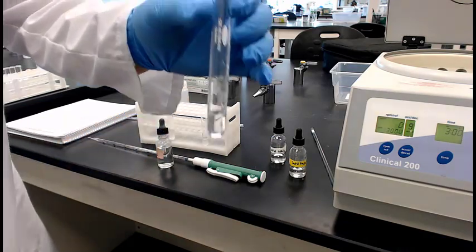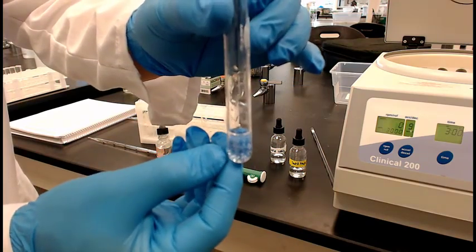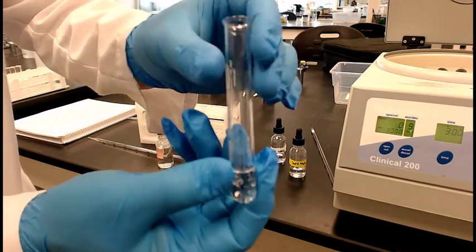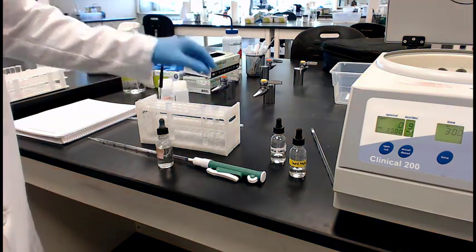He's having a hard time getting that lid on. Okay, wow. I wish he'd have done a little more shaking, but you can see that it's actually cleared up the precipitate on the bottom. All right. So that finishes step C and parts A, B, and C for this entire lab. So you're ready to start working on your write-up and also try the lab quiz.